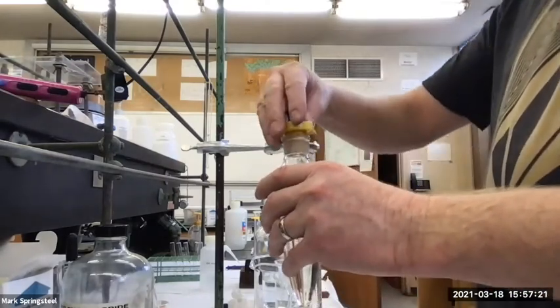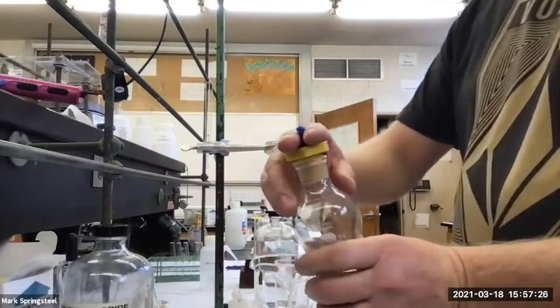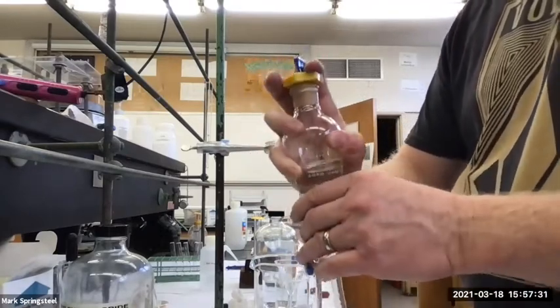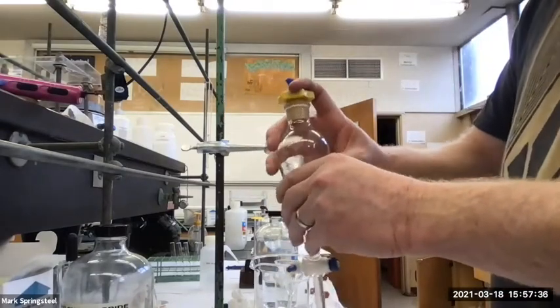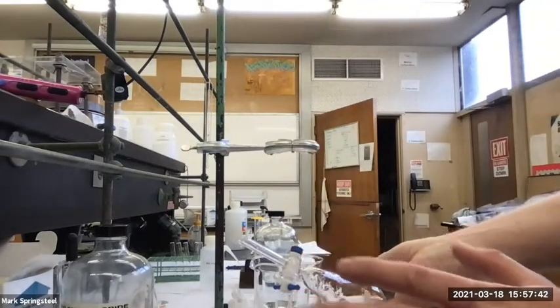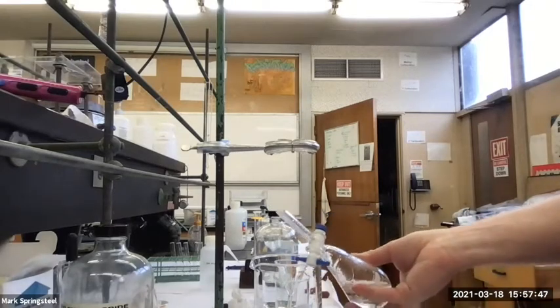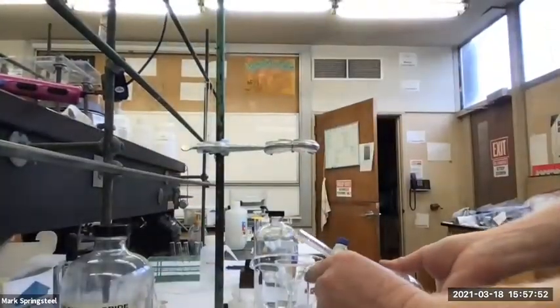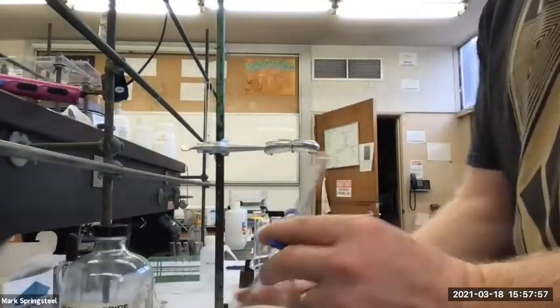So when you do this, you want to make sure your cap is good. And I like to hold it like this. I put my 2 fingers across the cap that way, and then I grab onto the rest of it. So I'm holding it nice and snug, and I'm pushing down on the cap. So I don't want the cap to come off. And then I always point it away from me towards like whoever in the class is the most annoying. And then I vent it. Just kidding. I don't point it to anybody. I point it at the back wall of this sink area right here. So if it does vent out, it doesn't hit anybody. Don't point it at anybody. Especially don't point it at yourself. That's like the worst thing you can do.